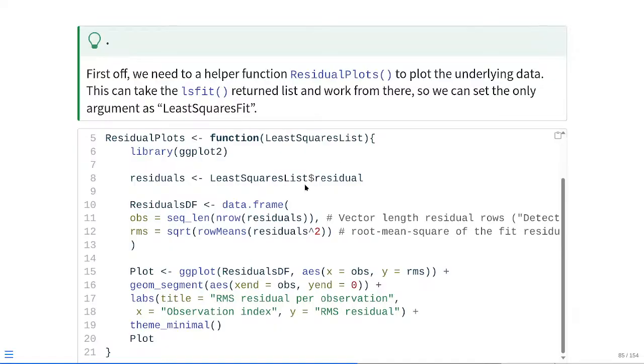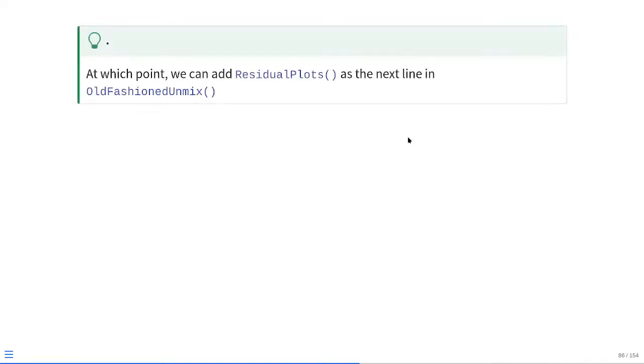And then at that point, within the actual function itself, we're just going to go ahead and do a lot of ggplot code. So in this case, by convenience I'm going to call library on ggplot2. We're just passing in a named list, so we're grabbing the residual component, and then deriving out some individual bits and pieces, like which are the detectors for observations, and then the root mean square, which is going to be the fit for the residuals, and then those are just being passed directly to the actual function itself. And then at that point, if we run the function in our local environment, we now have residual plots available to be used.